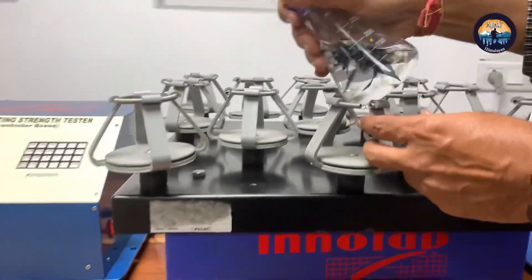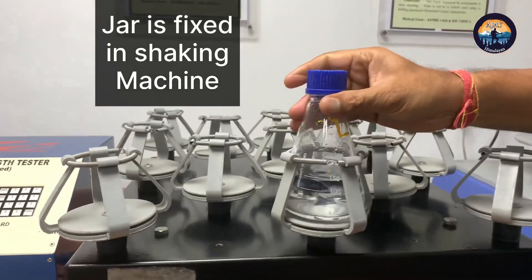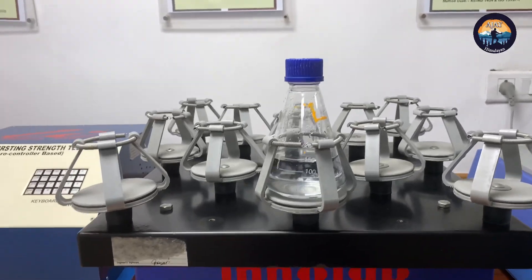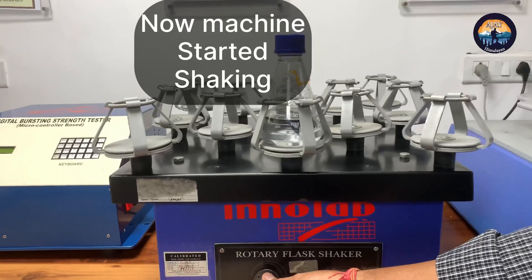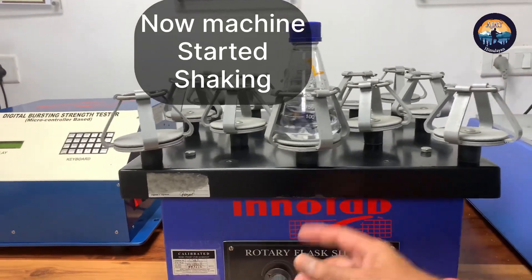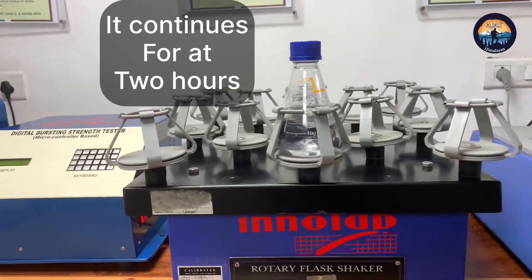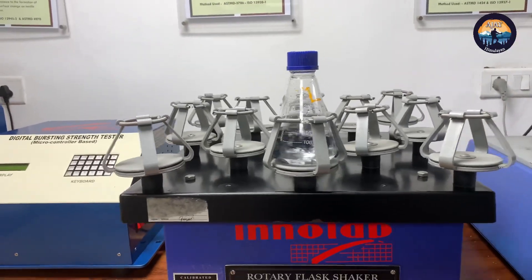Now the technician is putting the jar on the shaker machine. The machine has started shaking — it runs 40 rounds per minute and the shaking time is 2 hours.